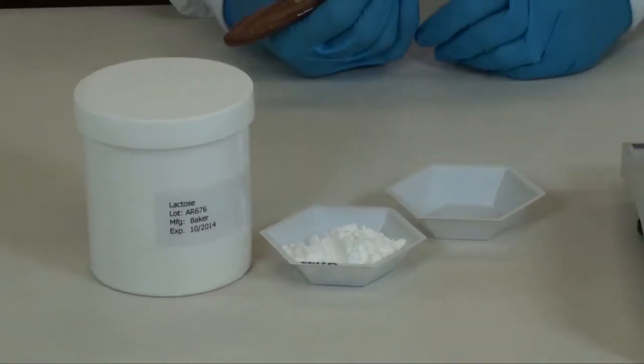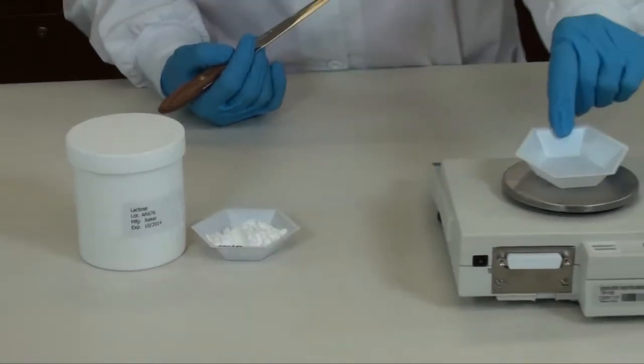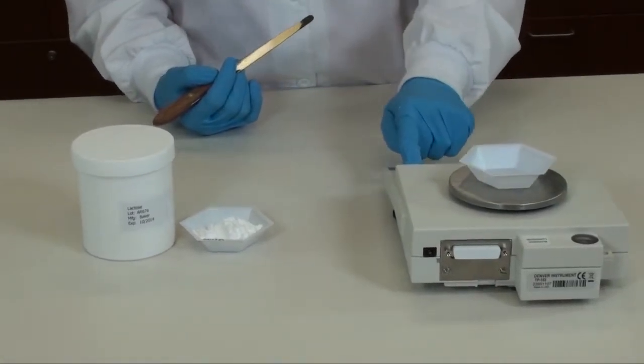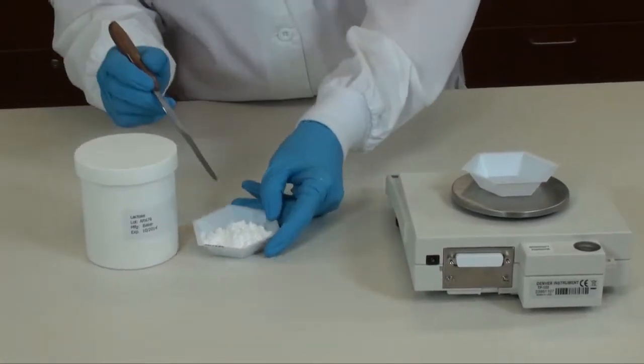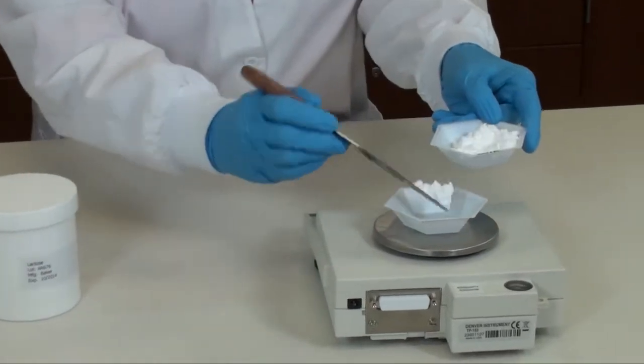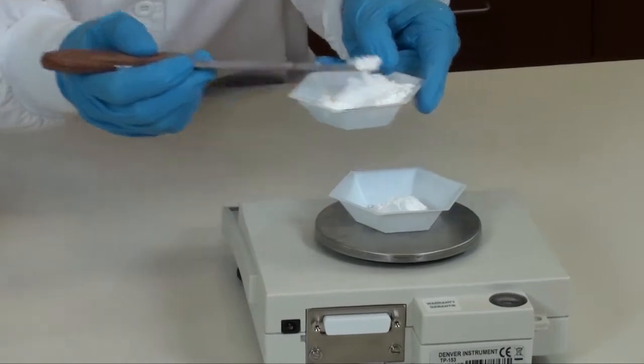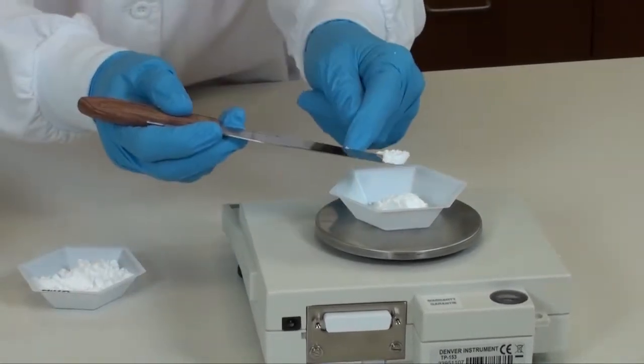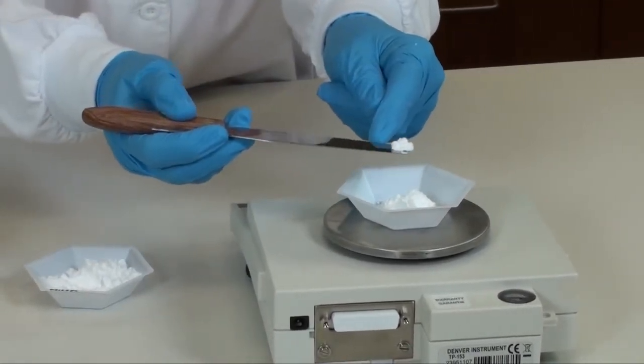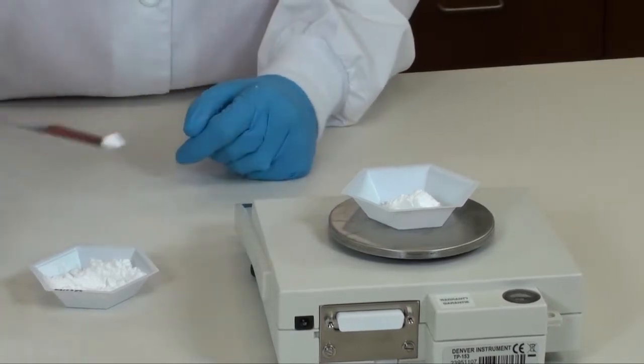Weigh the required amount of lactose. Place a medium weigh boat on your scale, tare the scale, and then weigh the required amount. Be sure to get within 5% of your target weight.